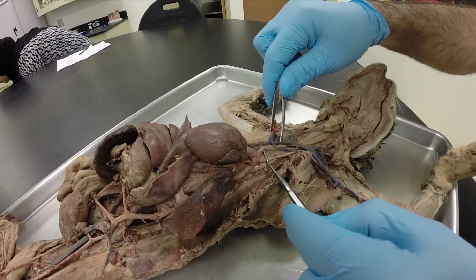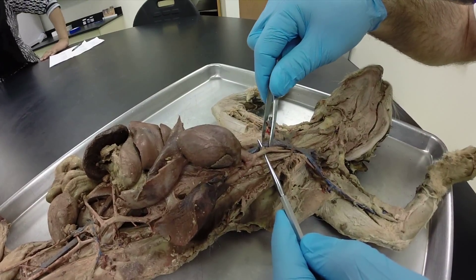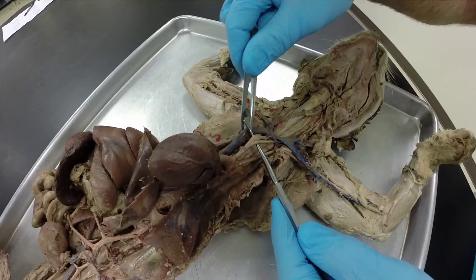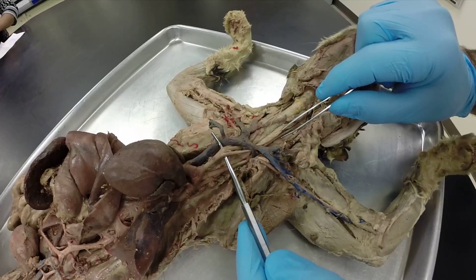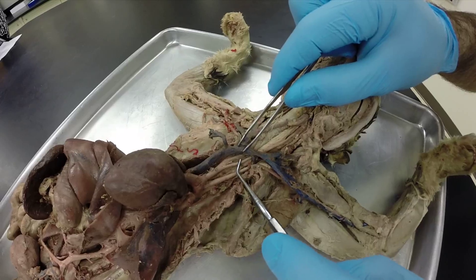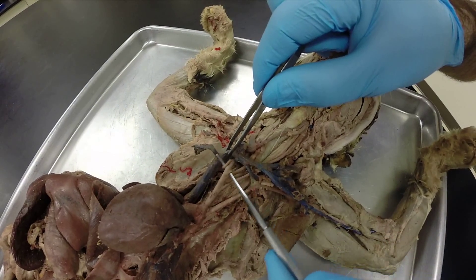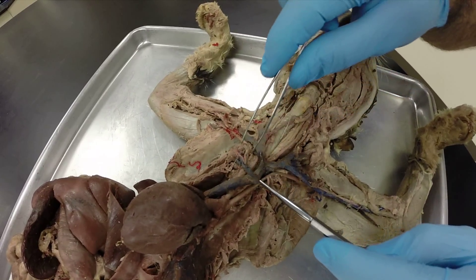The second branch off the aortic arch is our brachiocephalic artery. Following it up, we see that it branches three times. The first branch is the left common carotid artery, going up along the trachea. The next branch is our right common carotid artery, going up along the trachea. The final branch is our right subclavian artery.